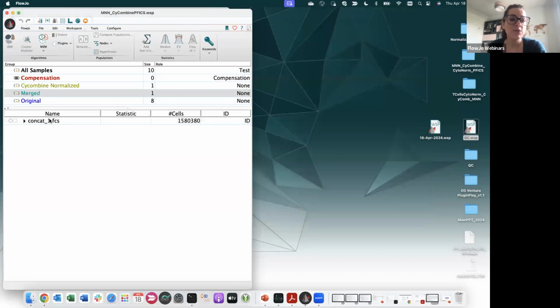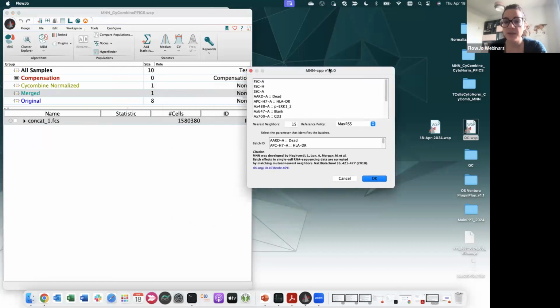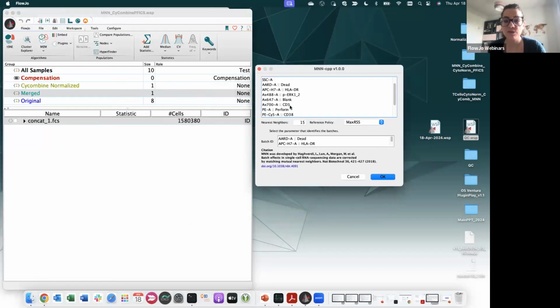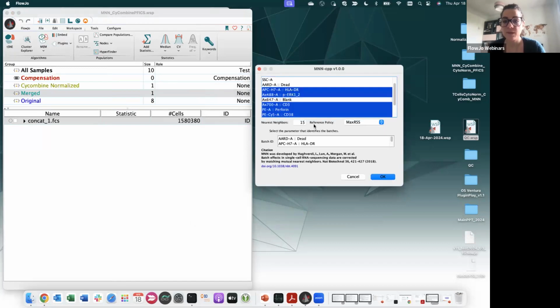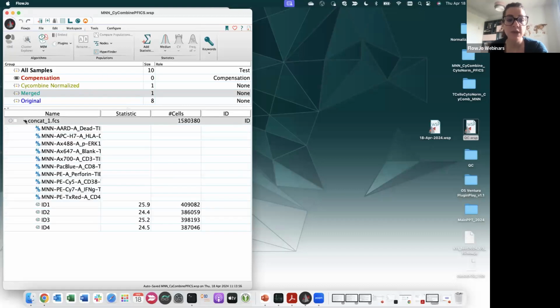okay? While if you run MNN, you go on plugins, click on MNN, same thing, select the parameters that you want to normalize. Okay. And then even here, you will need to select the batch ID keyword. So this one ID right here, and then you can click OK. What is the difference when you run MNN on the concatenated file, you will have normalized parameters right here, which are named as MNN. So these are the derived parameters that you will start looking at into your file.